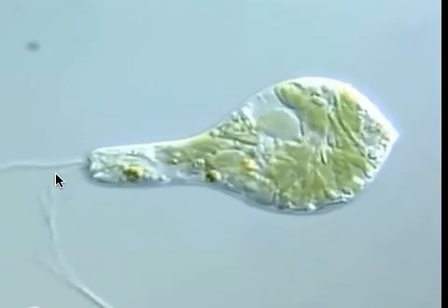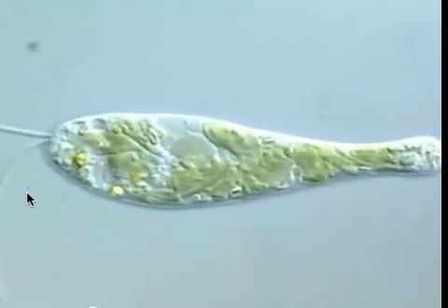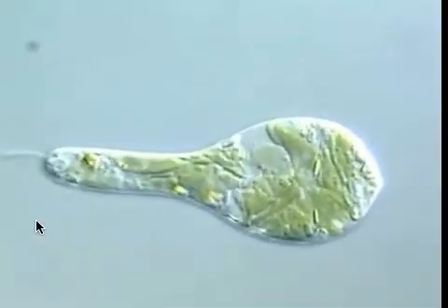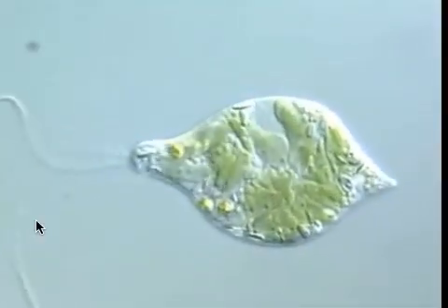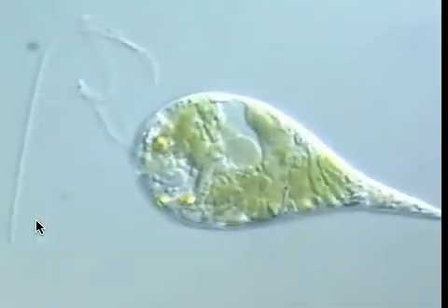Finally, we're going to be looking at a photosynthetic protist called euglena. Euglena has a whip-like structure called a flagella right here, and that's what the euglena uses to move. When you look at the euglena under the microscope, they'll be green, so they'll be easy to spot.